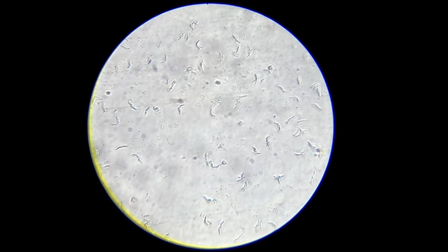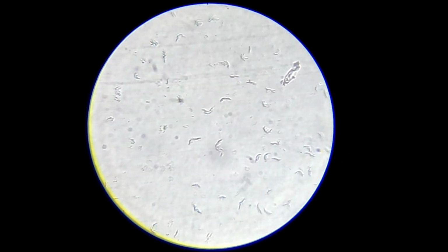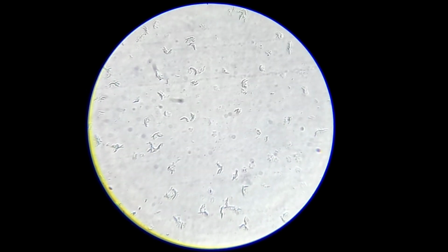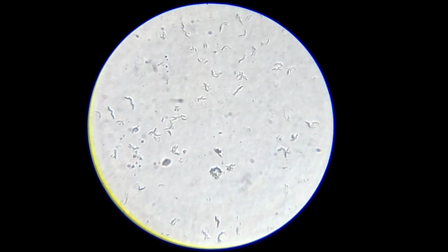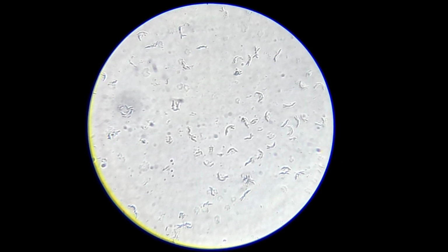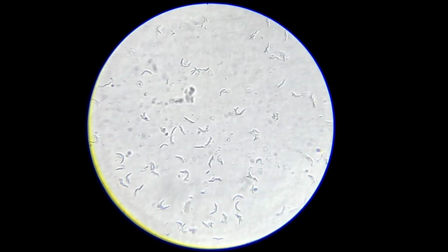Now I am increasing the magnification to 450x. At this magnification, bacteria are easier to resolve. I can see very small rod-like and dot-like structures. But again, there is no active motion. They are completely static. Living bacteria usually show either Brownian-like movement, slow drifting, or active swimming. None of that is visible here.